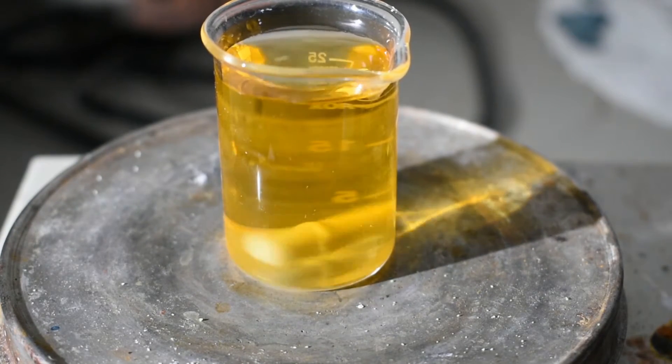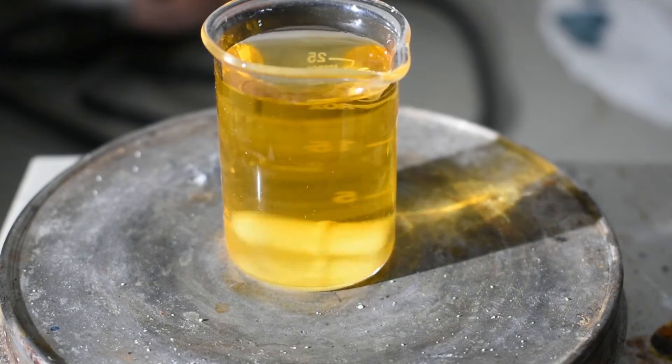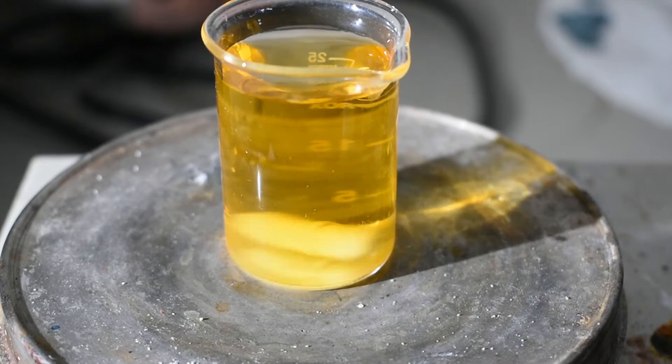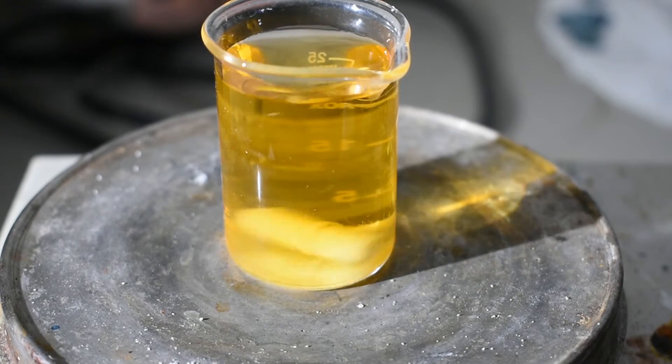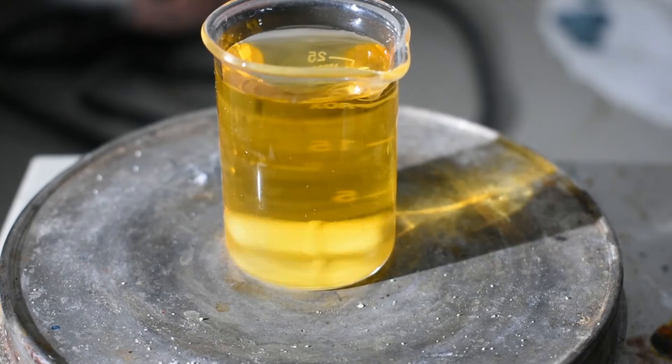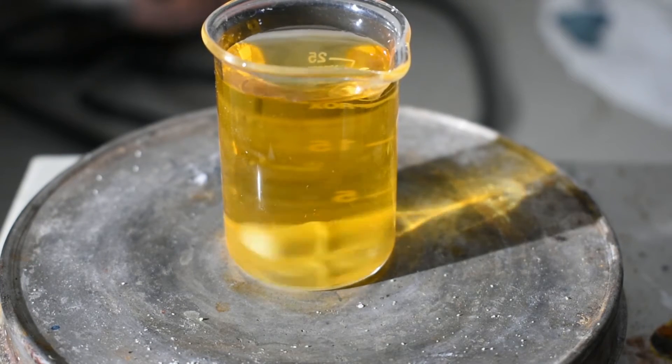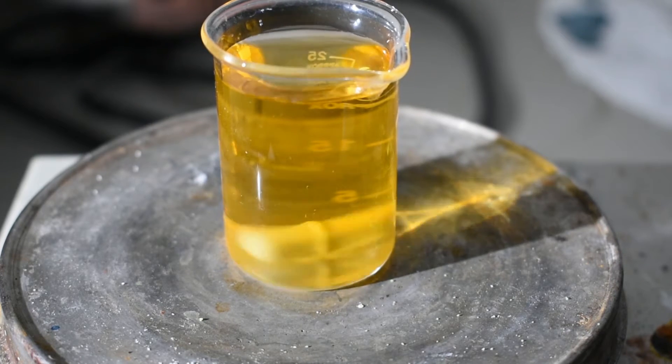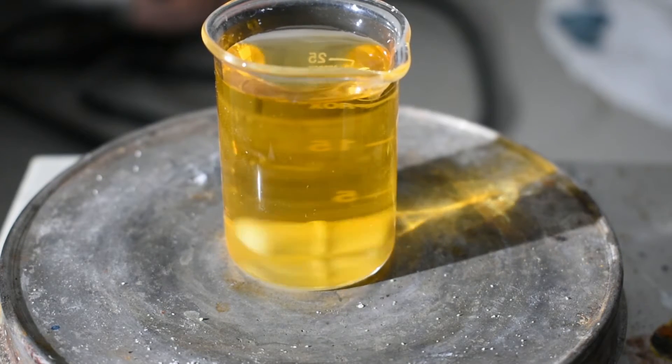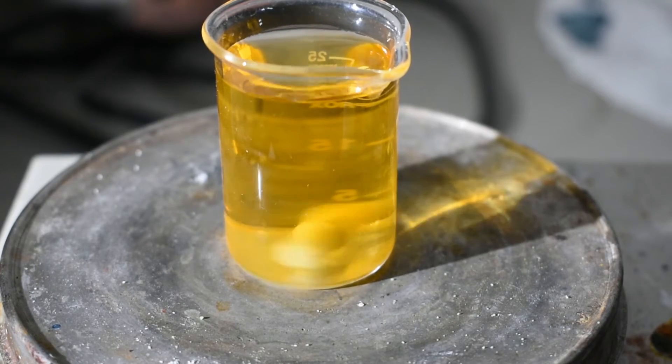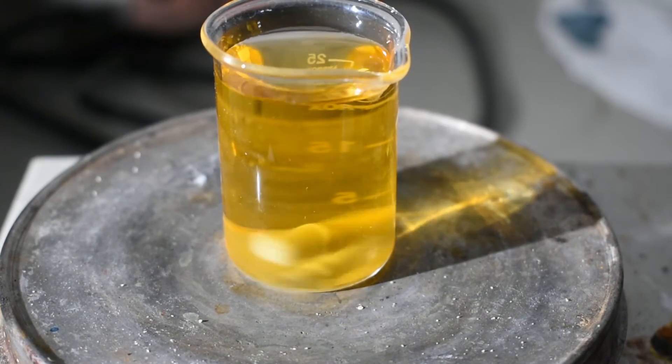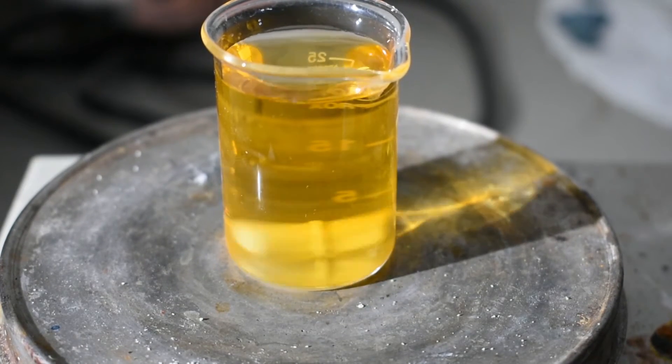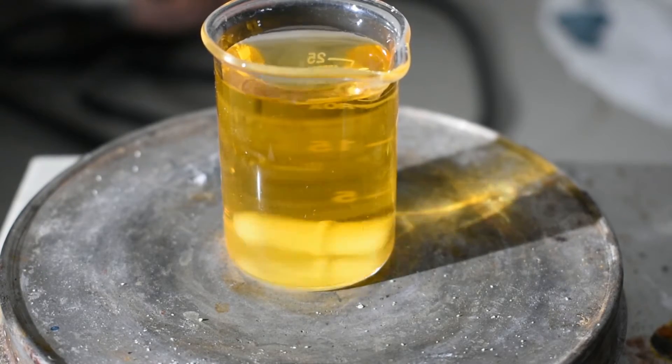To this, now, I'm going to add some potassium hydroxide flakes to make it strongly basic. The reason for doing this is that it will react with the zinc in the next step to form nascent hydrogen, which will reduce the nickel(II) complex to the nickel(I), which we will see as a very dark red color. But for now, I'm just going to add the potassium hydroxide. Now, on second thought, I'm going to get a bigger beaker.